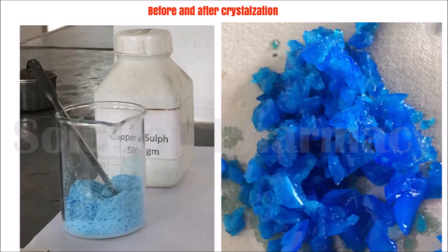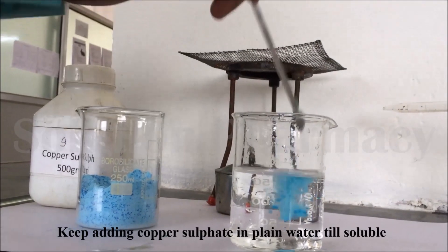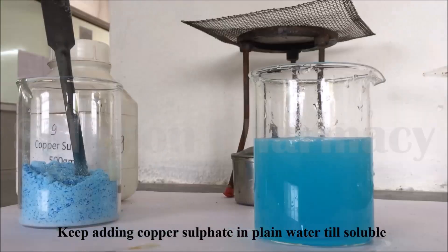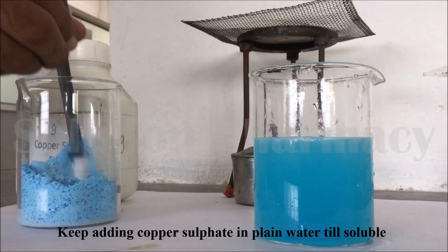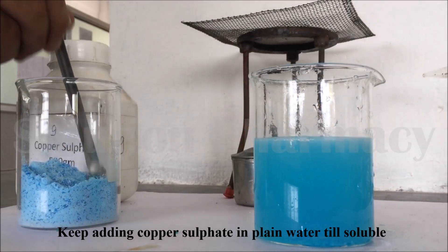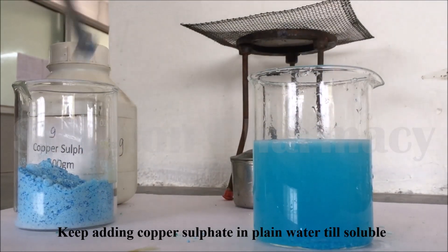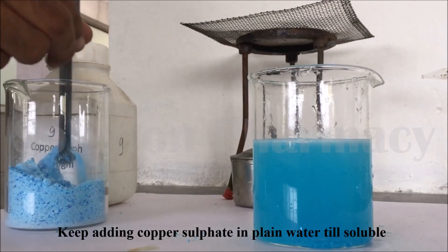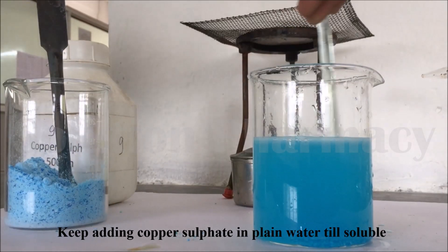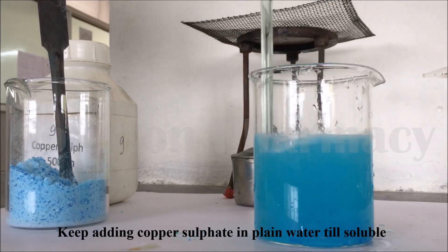Let's start the experiment on the crystallization process, in which we convert copper sulfate powder into crystal form. First, take water in a beaker — here we have taken 250 ml of water — and then transfer copper sulfate powder with the help of a spatula. Add a small amount of copper sulfate and stir it with a glass rod to dissolve it in the water.